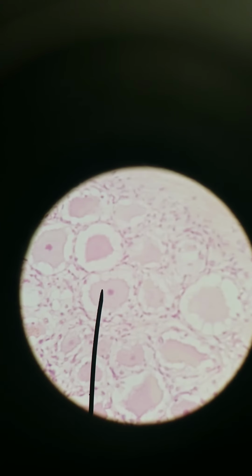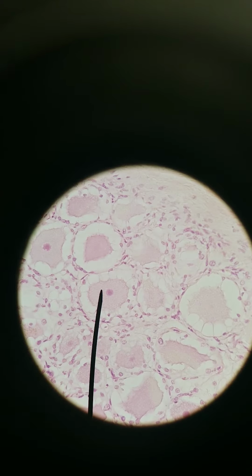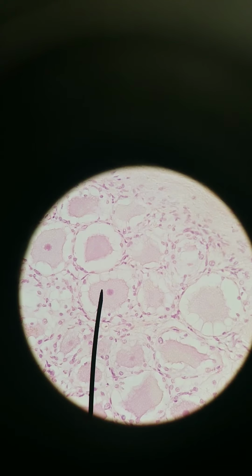These are called pseudo-unipolar neurons. Pseudo-unipolar. It looks like the neuron only has one side to it, but it has 2 sides. The way you can envision this, imagine a line, and then branching off of the line is the cell body. So rather than dendrites, cell body, then axon, like multipolar and what we'll see with bipolar, this is just a cell body off to the side with a major axon and a dendrite at the very, very tip, because the dendrites are going to be in the skin or some other area where it's sensing something. So in the dorsal root ganglion, we have these neurons, and the shape of these neurons is pseudo-unipolar.